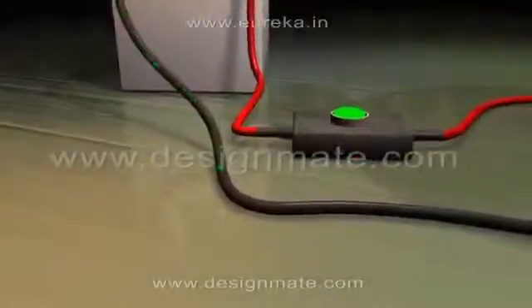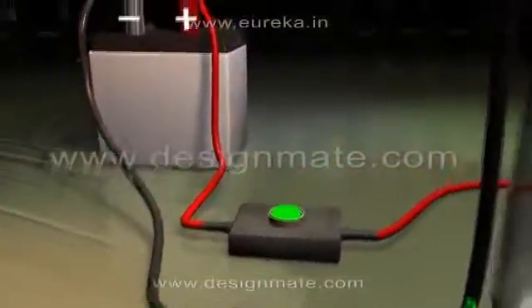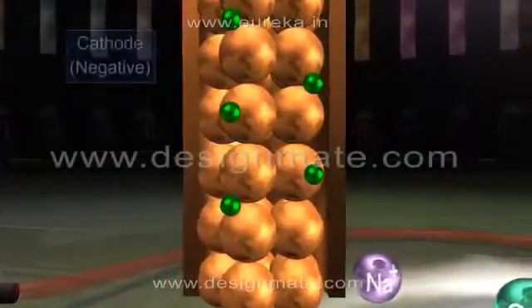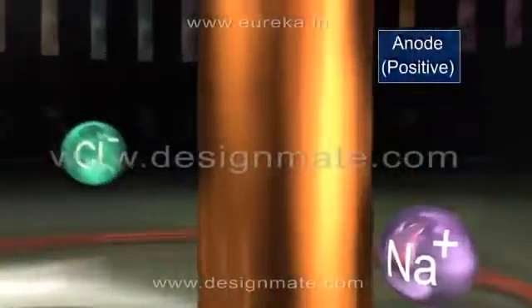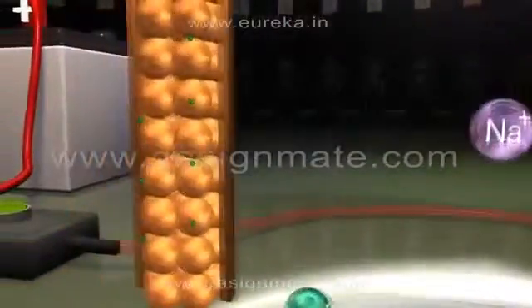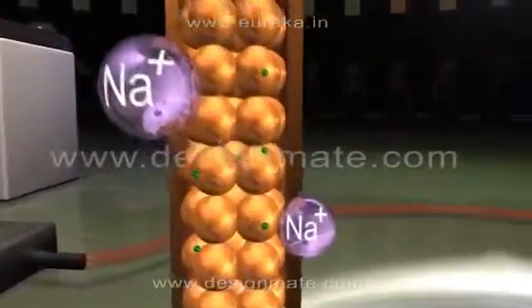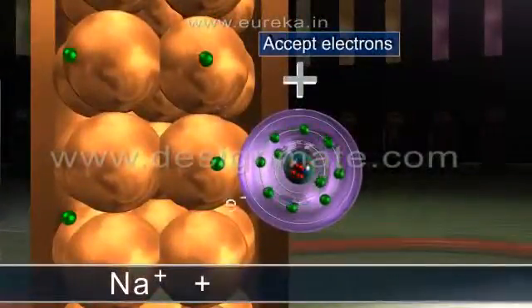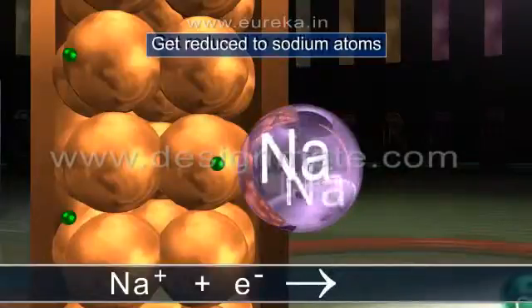When the battery is switched on, electrons move from the negative terminal of the battery through the metal wire to the cathode. This results in an excess of electrons on the cathode and generates negative charge on it, whereas the anode develops a positive charge. Sodium ions, being positively charged, are attracted toward the cathode. These ions accept the electrons from the cathode and get reduced to sodium atoms.